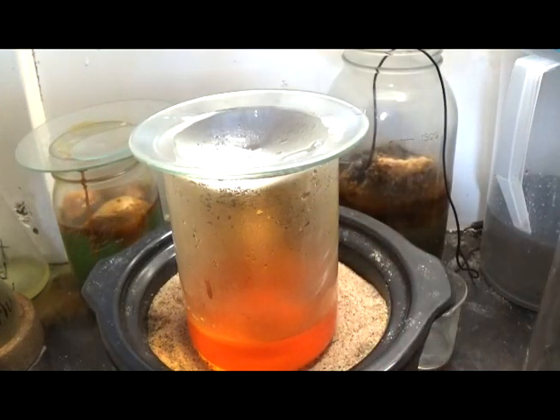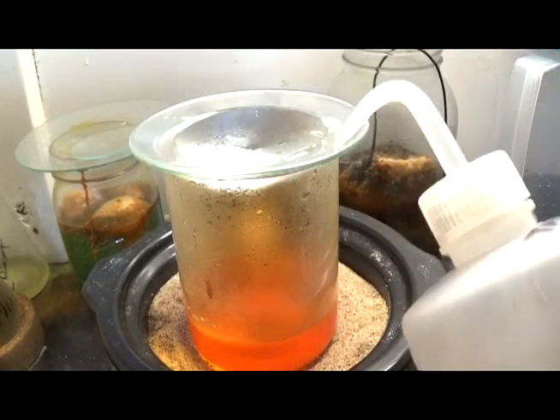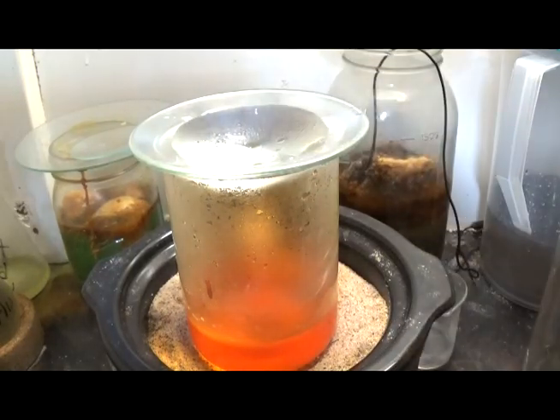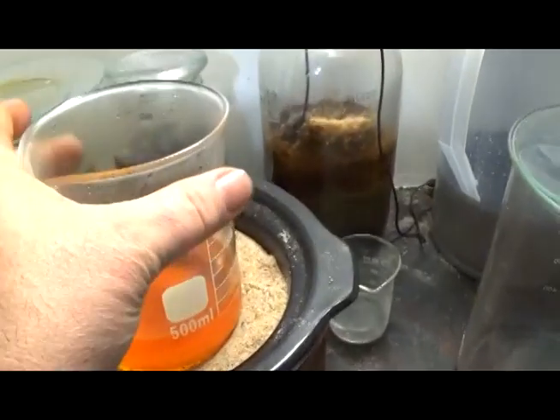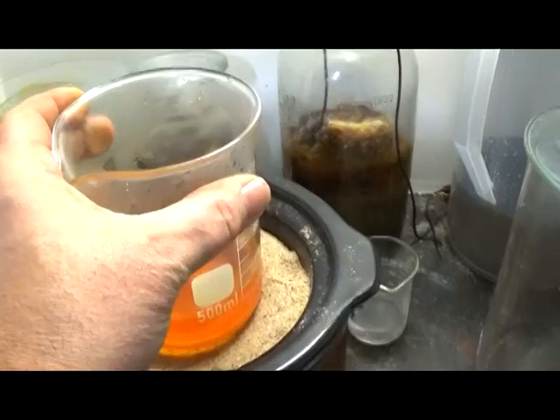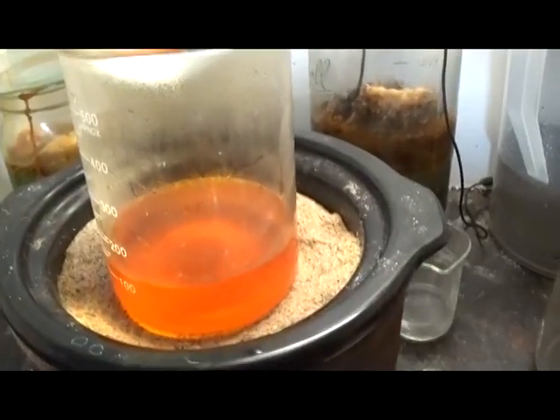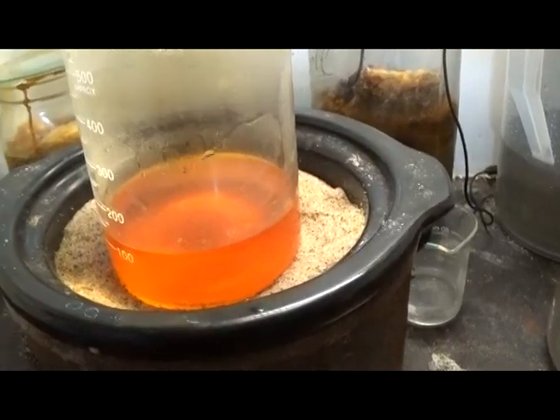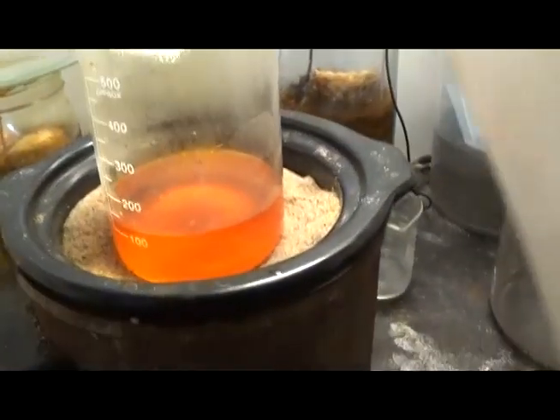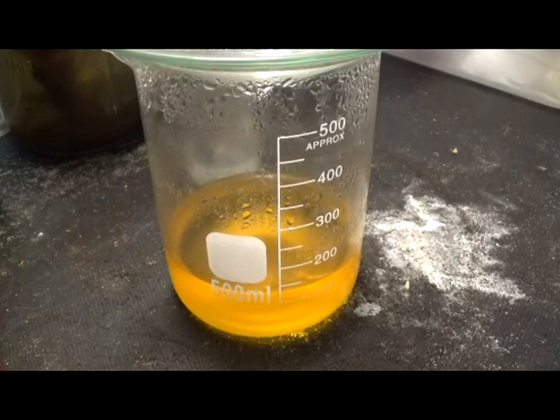And we got some real good fumage going on in here, nitrogen dioxide gas. That's actually a good thing. So we're going to condense that gas, bloop, drop it back down as nitric acid, then further dissolve more of this gold dust. All right, it looks like 8 milliliters of nitric acid did the job. But we're going to add a couple more milliliters just because I think it needs a little bit more kick. 10 milliliters of nitric acid is all we put in this. And probably didn't even need the last 2 milliliters, but my gut told me we did. So I'm going with the gut. Now I'm just going to let this sit here and do its thing probably for another half an hour or so. All right, if you can hear me over this fan, we'll go ahead and do the drop.